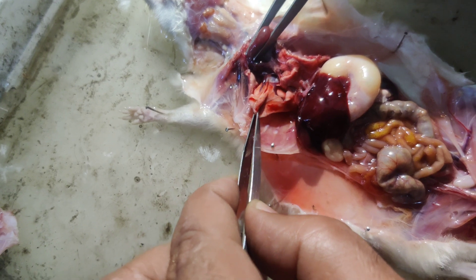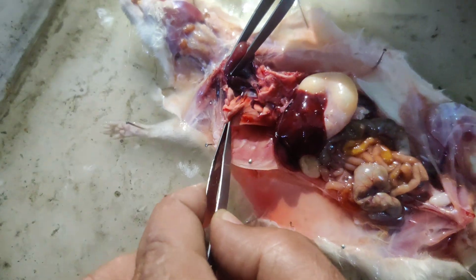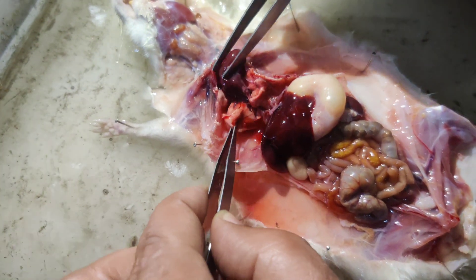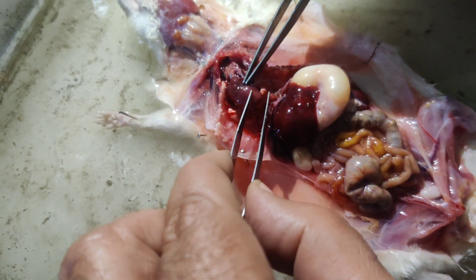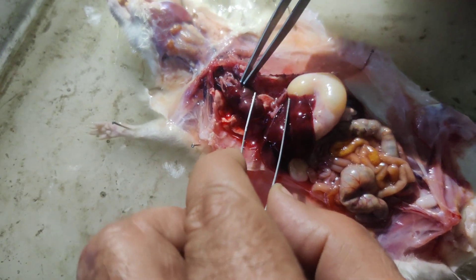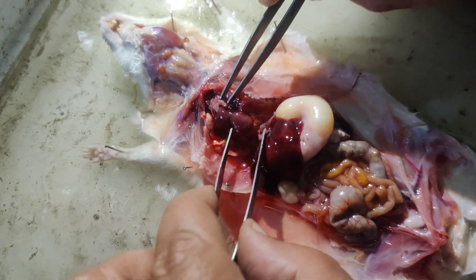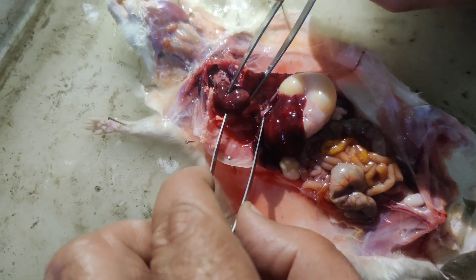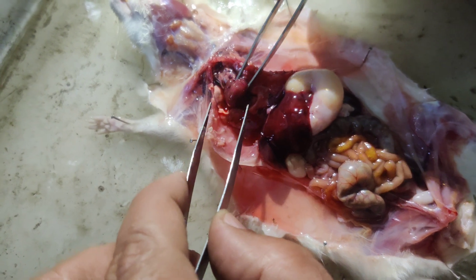You can see the blood supply in the lungs as well. This is the right lung and this is the left lung. These upper two structures are the auricles — this is the left auricle and this is the right auricle — and this lower one is the ventricle.